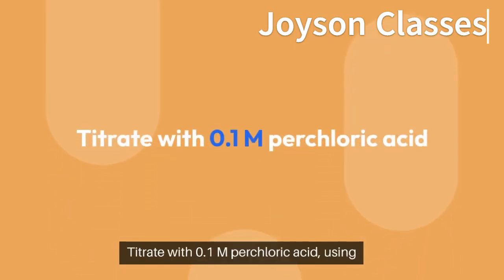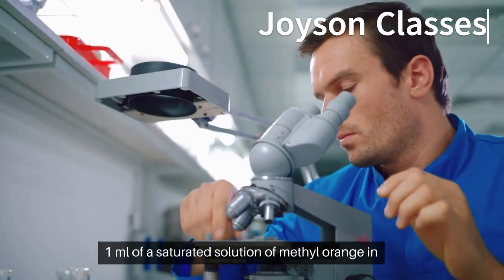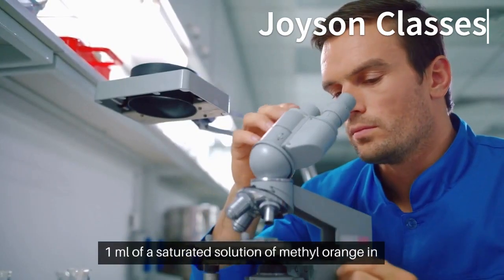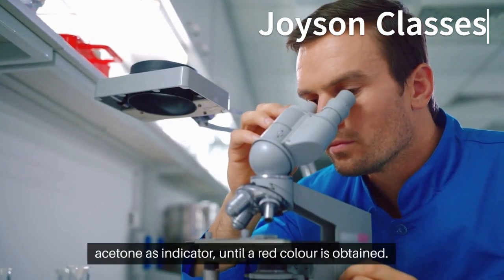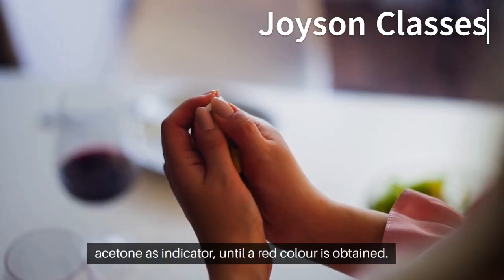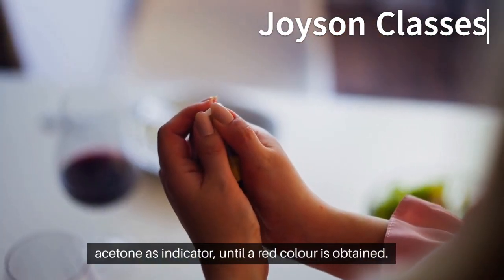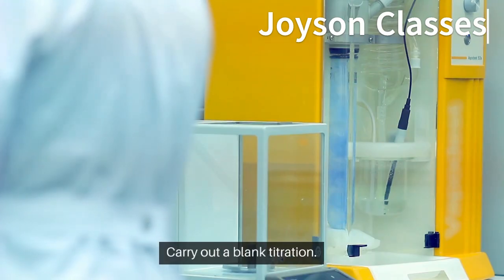Titrate with 0.1M perchloric acid, using 1 mL of a saturated solution of methyl orange in acetone as indicator, until a red color is obtained. Carry out a blank titration.